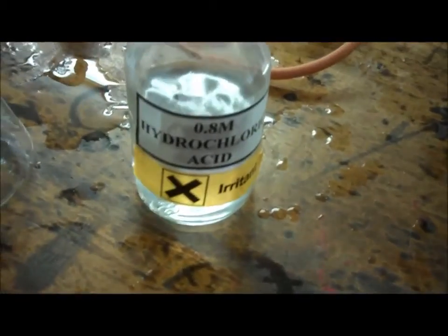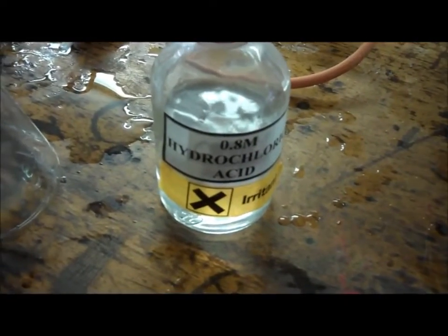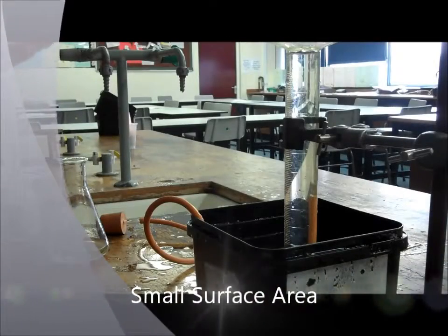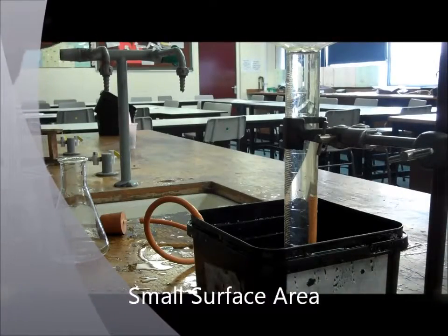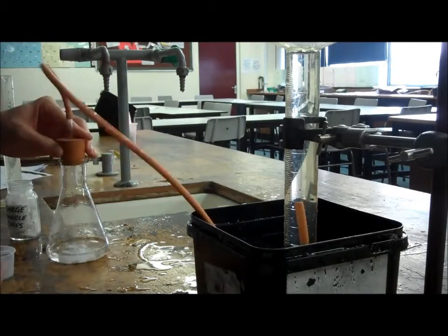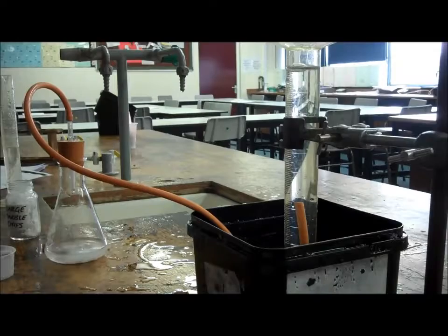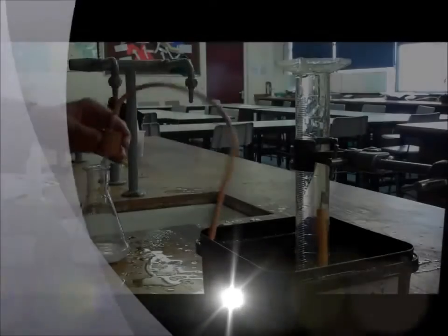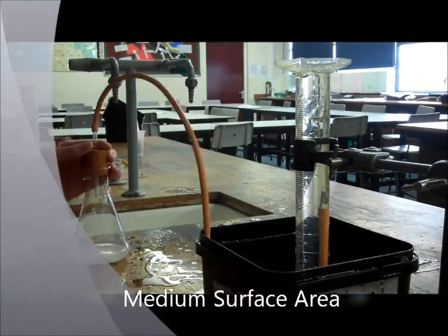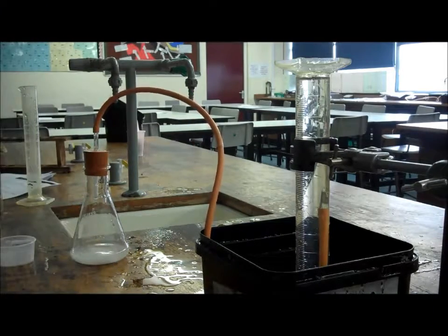For this experiment, we need to keep the temperature and the concentration the same, so we're going to use room temperature 0.8 molar hydrochloric acid. First one then, small surface area, large marble chips. Next one, which is the medium-sized chips.